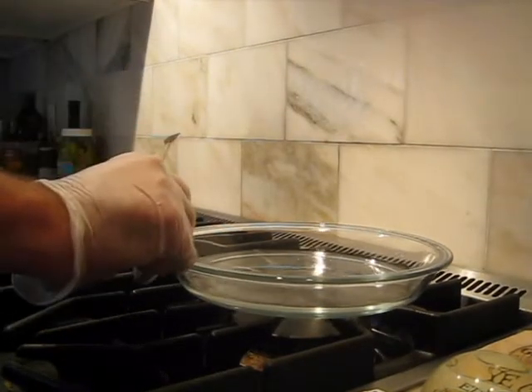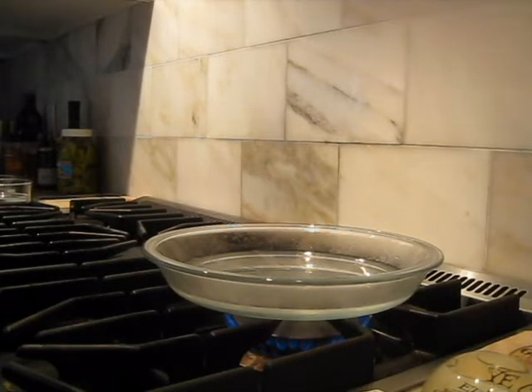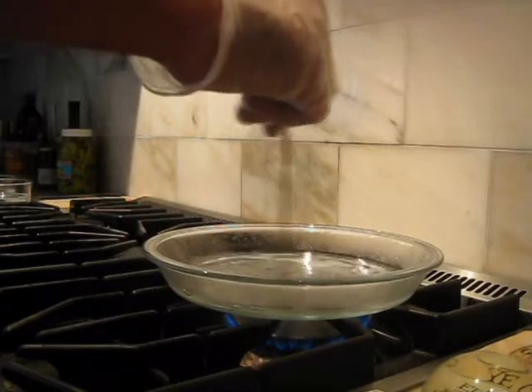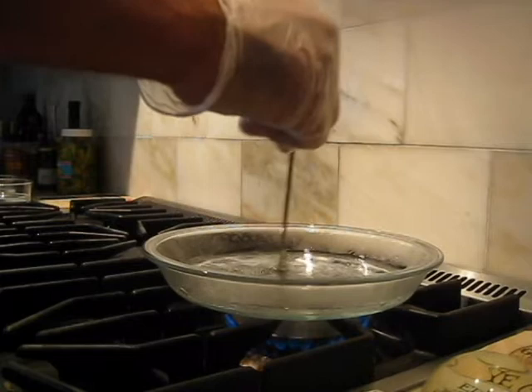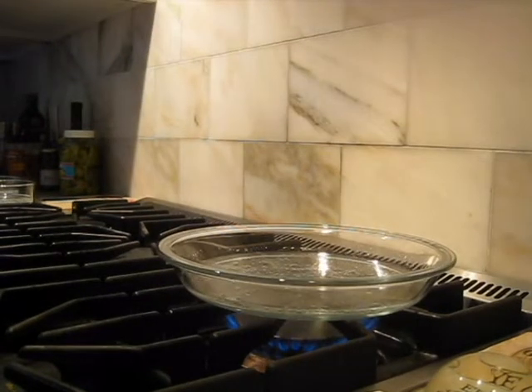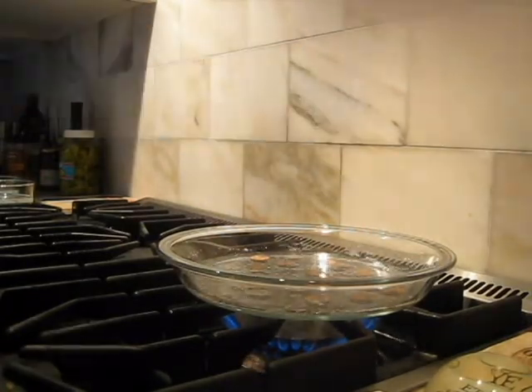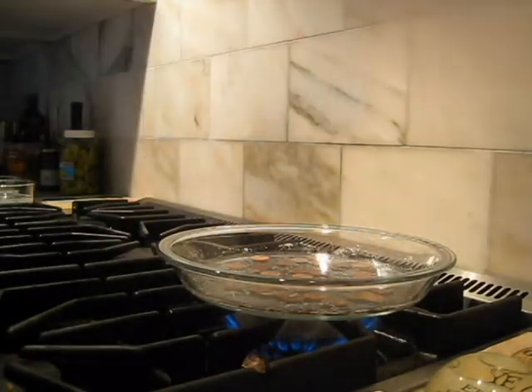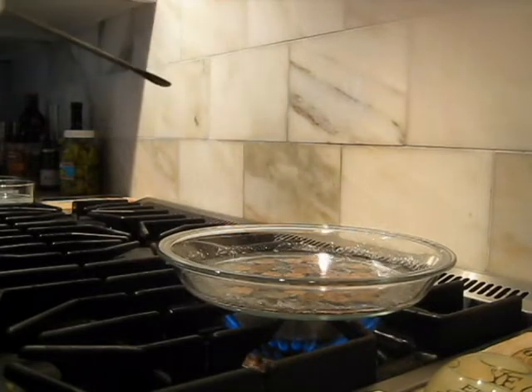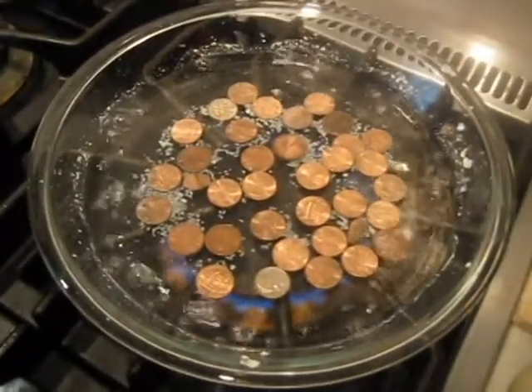Now I have prepared the zinc sulfate. I put half of it in here. I'm going to start heating up with ventilation on. I'm going to add some zinc powder, which is flammable, so I don't want to get it near the fire. It's actually not powder - it's granular. I'm supposed to get this to boiling. Put about five grams in.